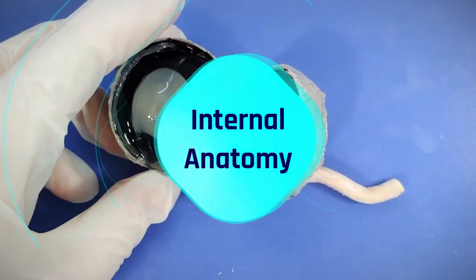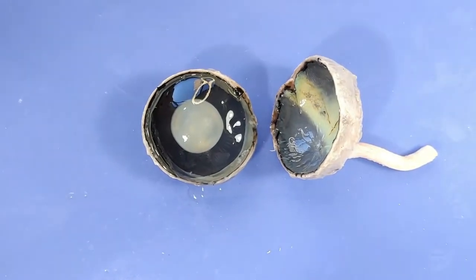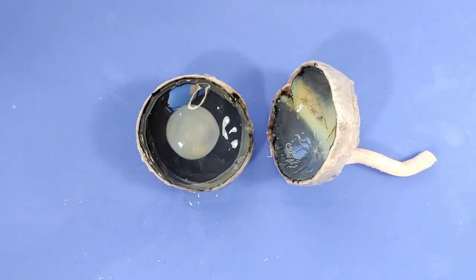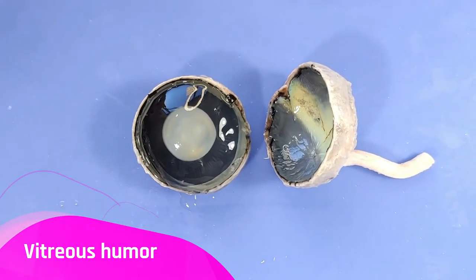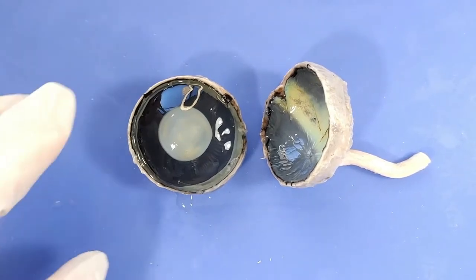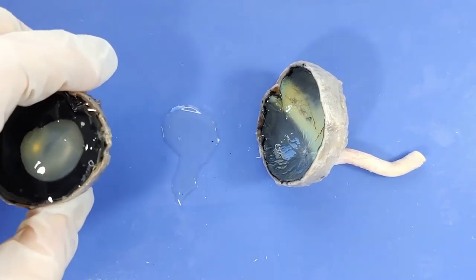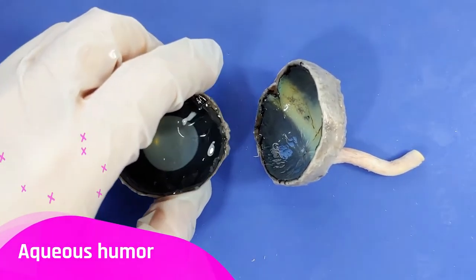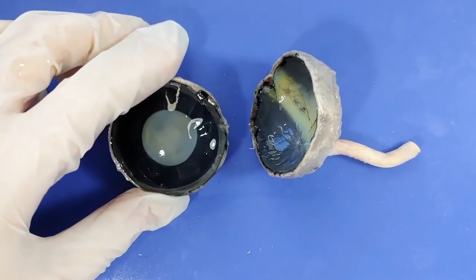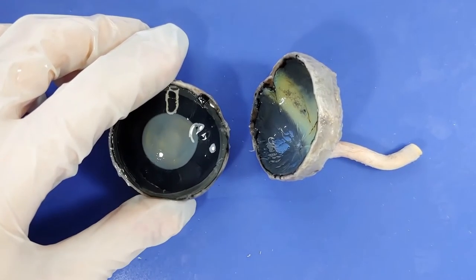Now let's take a look at the internal anatomy. Now that we have the eye open, you can see this clear gel-like substance. This is called the vitreous humor, and it fills the eyeball to help it keep its shape. This more liquid substance that pooled at the bottom is called the aqueous humor, and it also provides pressure to keep the eyeball from deflating, but it also does other things like transporting nutrients like amino acids and glucose.